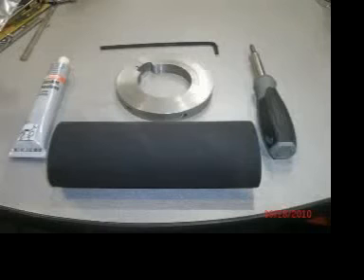A tube of Permatex number 1, a tool for compressing the rings, and an Allen wrench to operate that tool. A combination screwdriver. You could use a couple of different kinds of screwdrivers, but I like the combination type. And a bladder, of course. It's also recommended to have some solvent and some rags. We like using ethyl acetate.